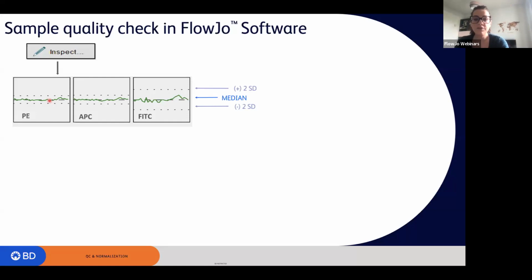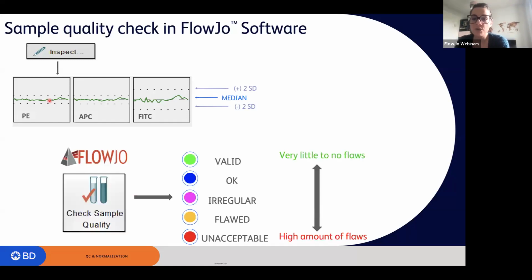If everything was okay, FlowJo will give you a badge color next to your file, which can go from green to red based on the number of alterations that we had. These can also be applied to the entire data set just by using the check sample quality tool that is available right away within FlowJo. So it is not an extra tool, it is a default tool.